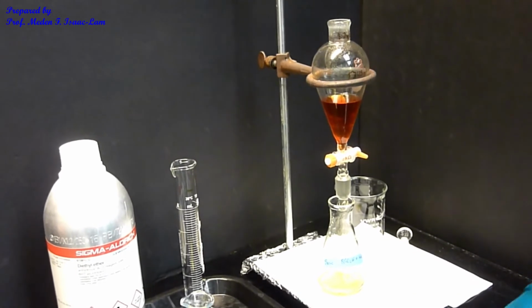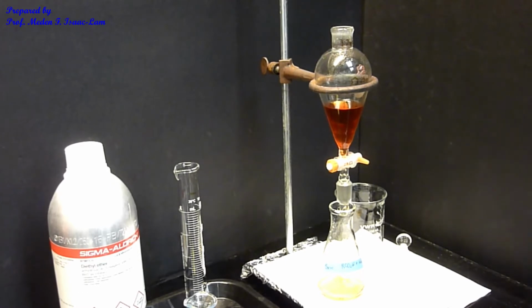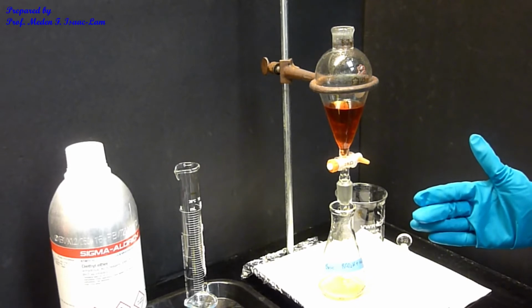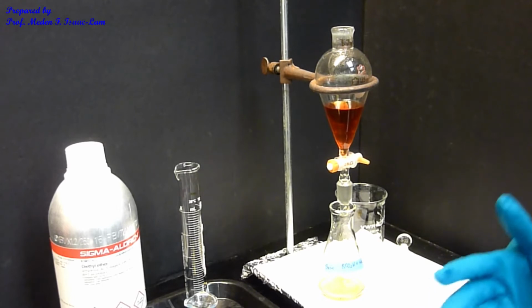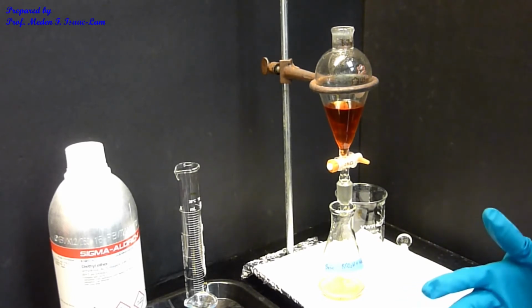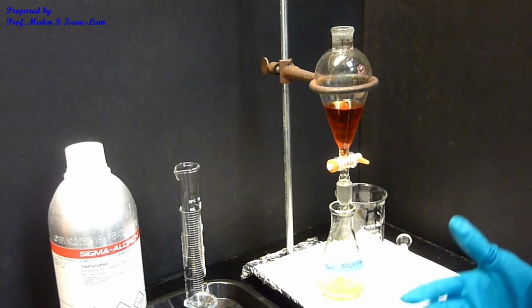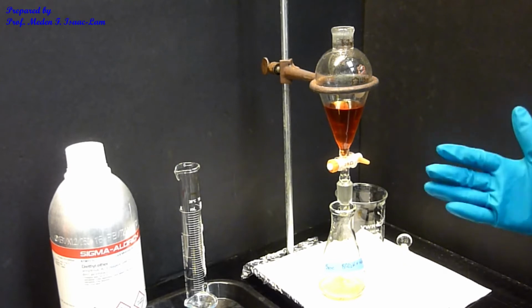So the purpose of doing 2 extractions is to make sure that I was able to get rid of the acid component in my mixture by doing another extraction. So it's better to do twice 10 mL as opposed to one time 20 mL. If you are doing multiple extractions, using half of that amount of solvent each time is better than doing one extraction with that same total volume.